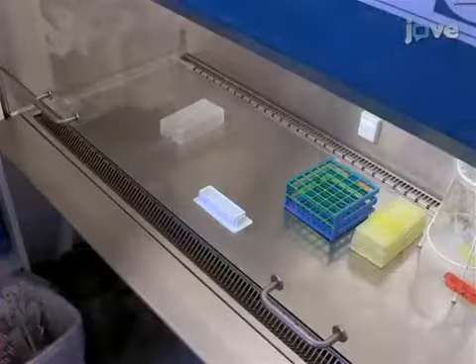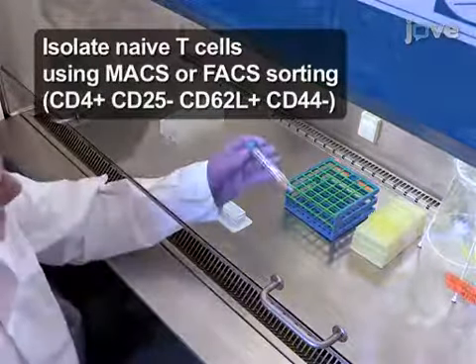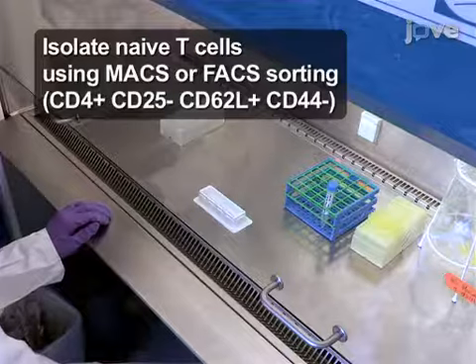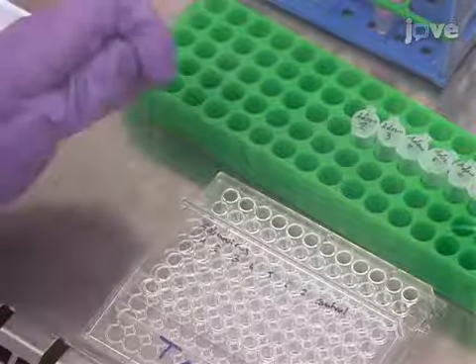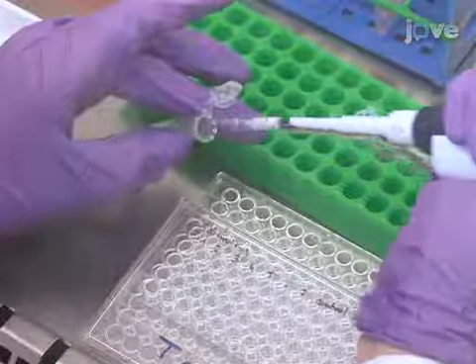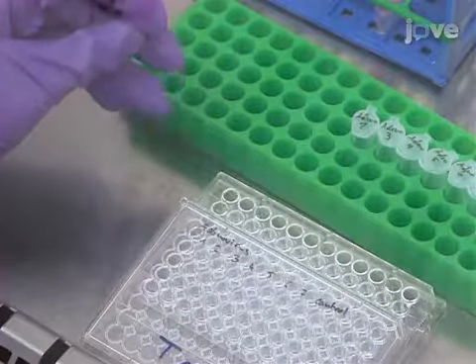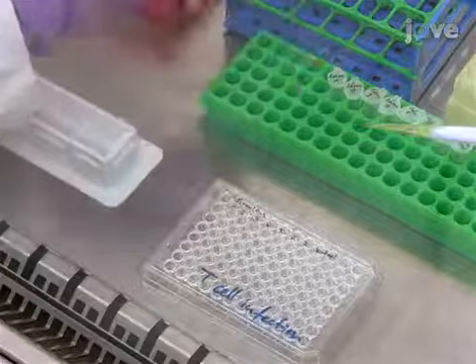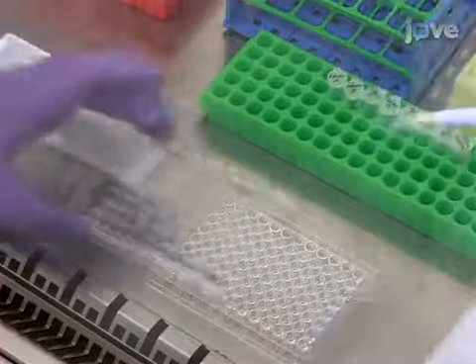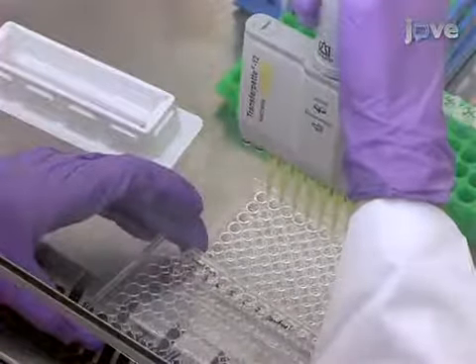This part of the protocol is performed using naive resting CD4 T cells isolated from DO11.10 transgenic CAR delta 1 transgenic mice. For small-scale experiments, pipette an appropriate volume of viral lysate to achieve an MOI of 50 into 1 well of a 96 well round bottom plate. Add up to 4 × 10 to the 5th T cells in a final infection volume of 50 microliters in T cell medium. This setup allows parallel experimental approaches.